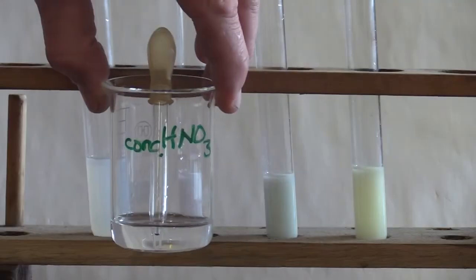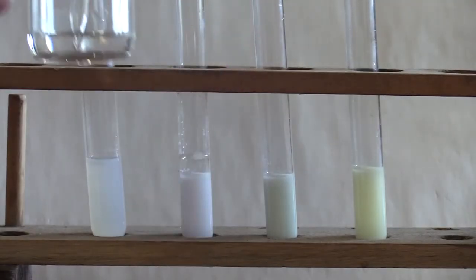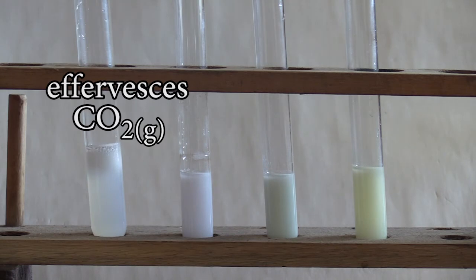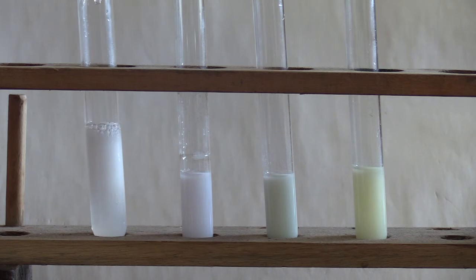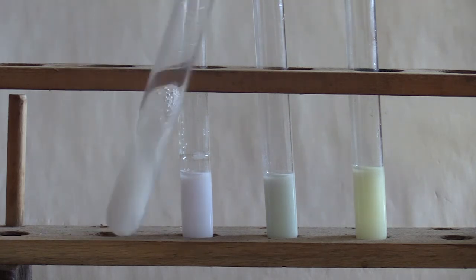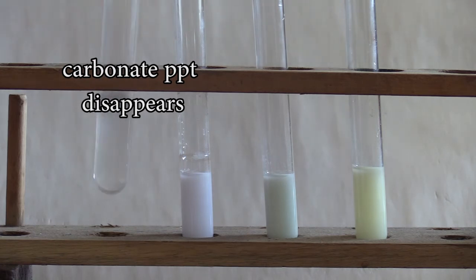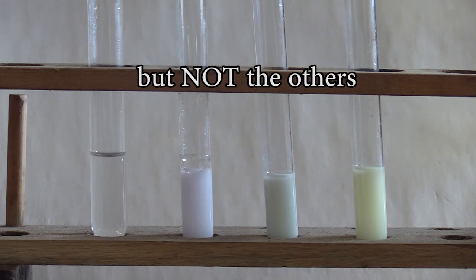So if we add a few drops of nitric acid, we see the carbonate effervesces, decomposes the precipitate, the carbonate into carbon dioxide, and after a while we'll see that the precipitate has totally disappeared, unlike the others.